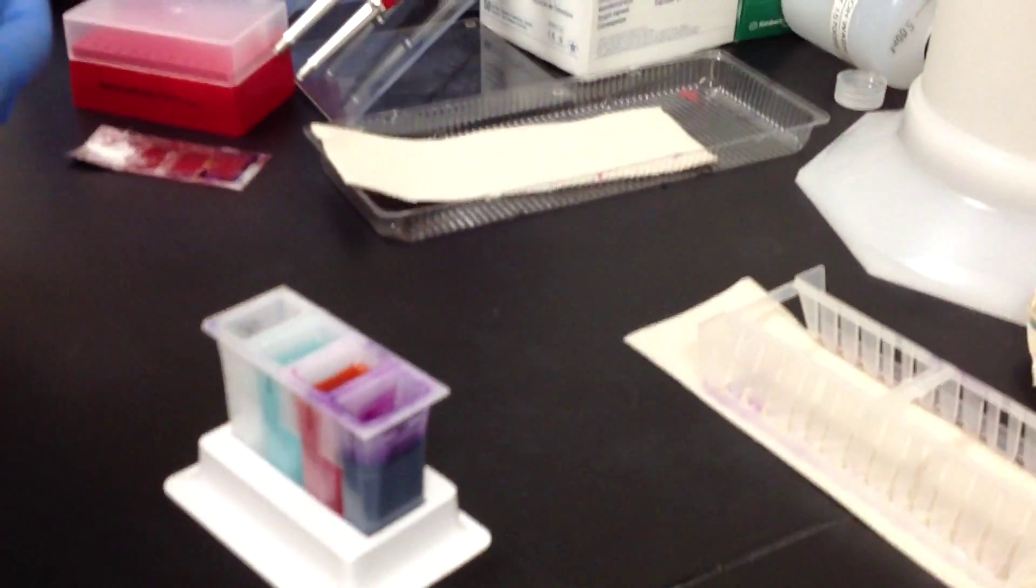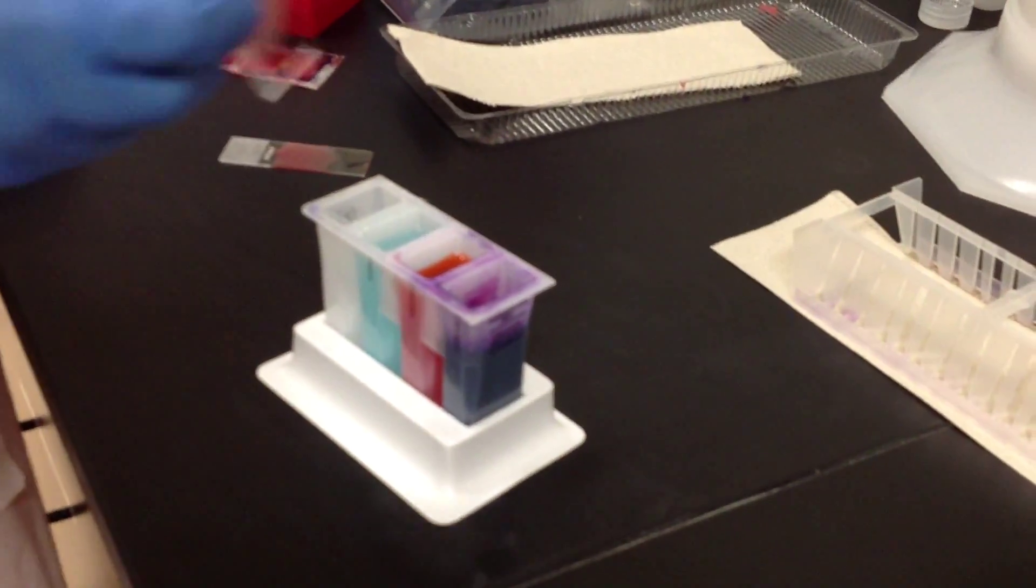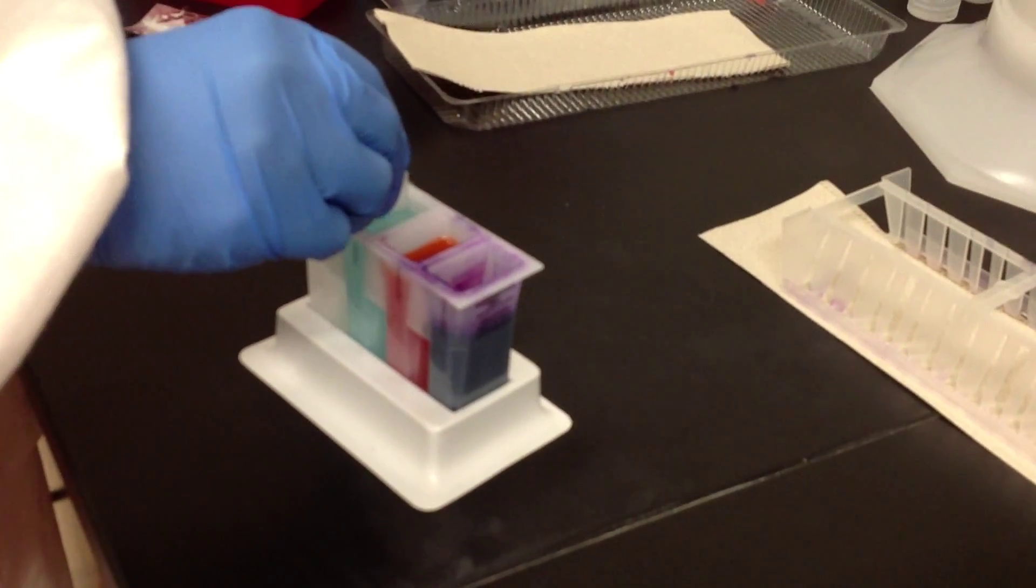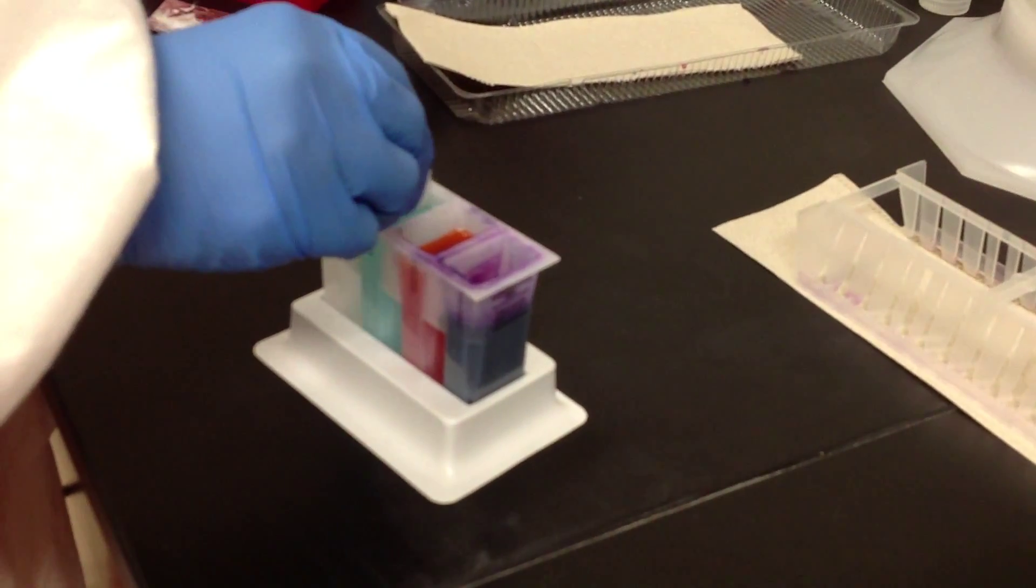Okay, let's do this again. I'm going to go over here and use our smaller staining kit. So we're going to put our dried smear in the fixative, allow it to sit, and give it a little slosh to make sure it's covered very well.